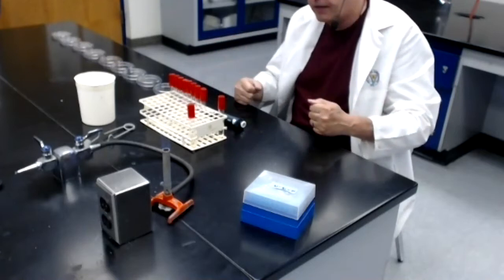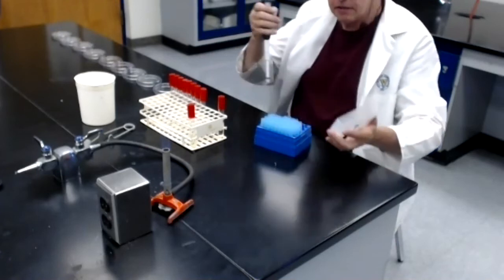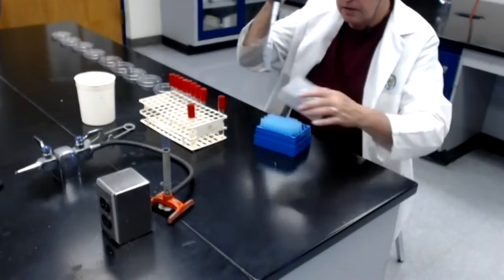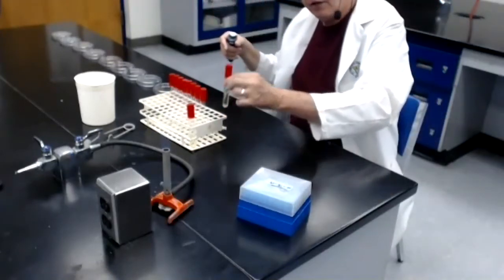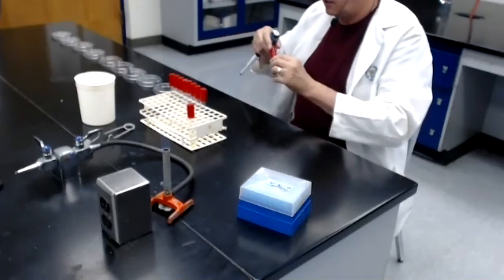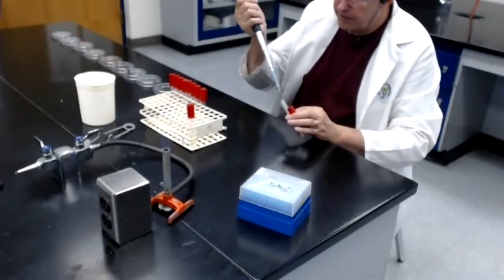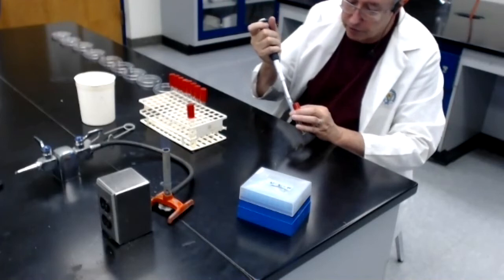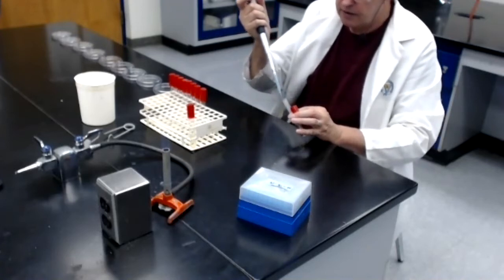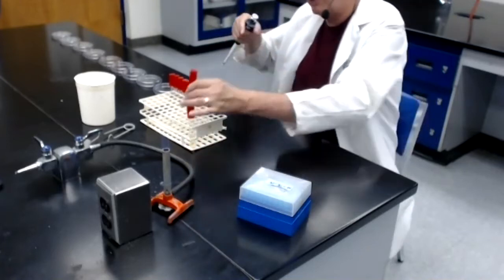So how do I do that? First thing I do is I grab my micropipetter, get the box of tips, load up a tip, close the box, make sure the pipetter is still set at 1. Of course it is. I now grab the number 2 dilution, the 100th, remove the cap, flame the mouth, put the pipette tip below the surface of the water, pull the trigger, automatically withdraw 1 mil of the 100th dilution, flame the mouth of tube number 2, replace the cap, put it at the back row.